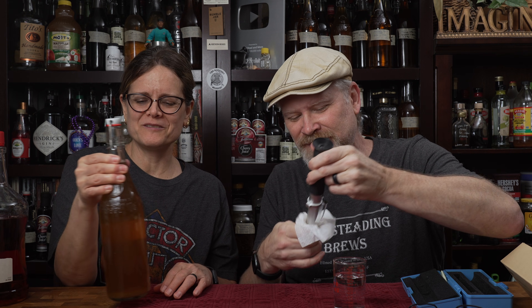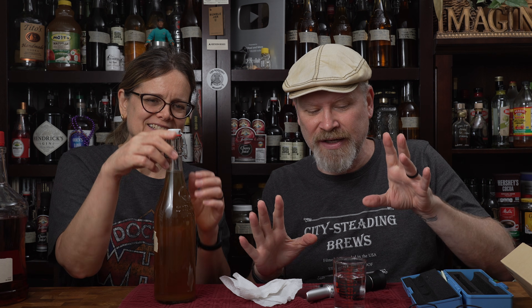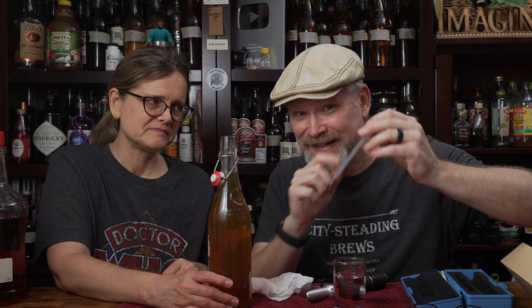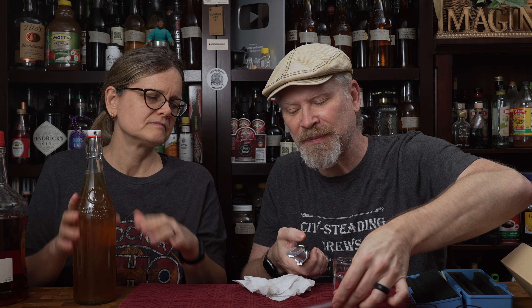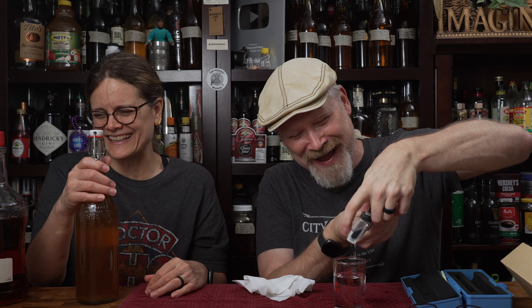Next — this is leftover step feed mead, which should be 17 percent. This one's a higher percentage, so hopefully that higher percentage helps it be more accurate. By the way, I did switch pipettes in between, so I wasn't using the one with whiskey on it. Now I just cleaned it out. And oh wow — this one reads 40 percent! We make some powerful mead. That is amazing.